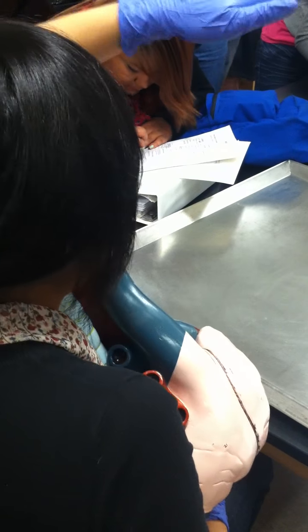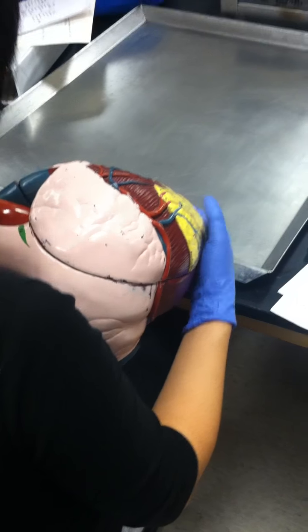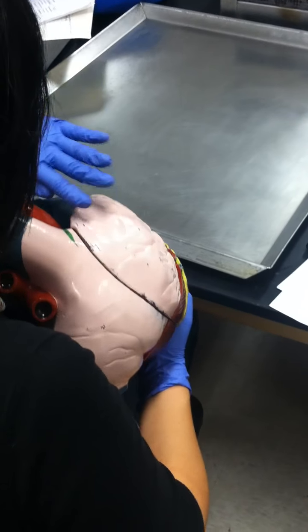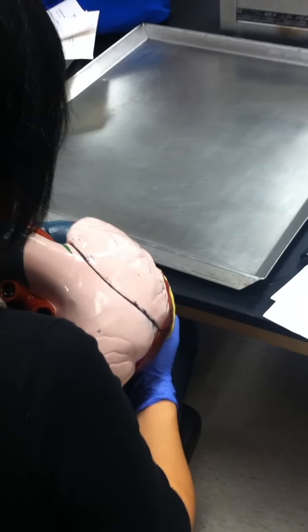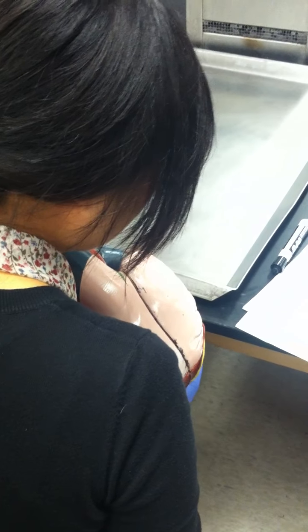It's actually on the top, right? Generally, when people think base, they think the fundamental thing is on the bottom, holding it up. Actually, generally, flat structures are what base is. So in our case, the heart is like a strawberry. The flat part is on the top, so the base is on the top, and then the pointy part is the tip, the apex. Apex versus the base. Okay. And I think we went through all the important terms.